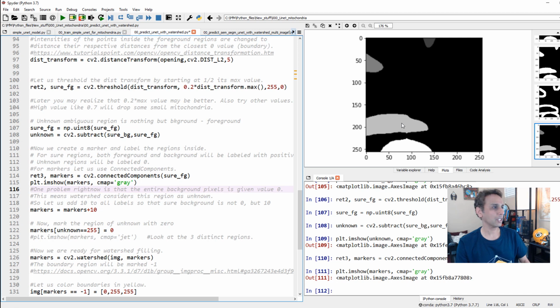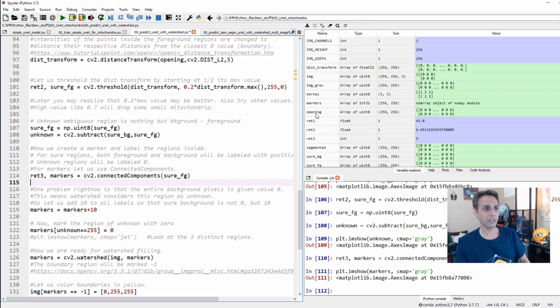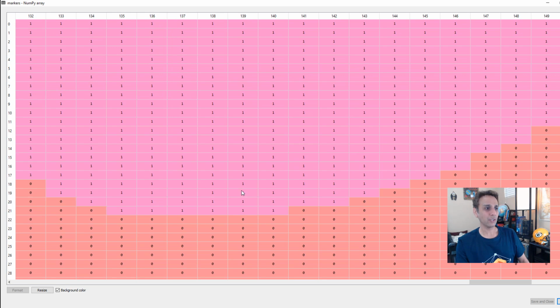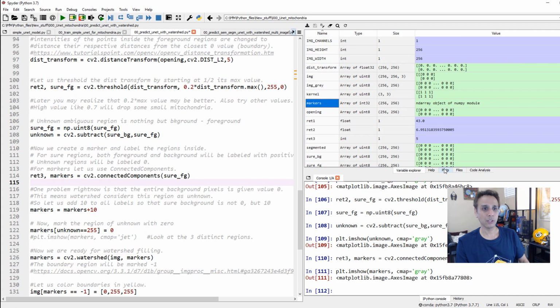So these are all our markers, and again, all it's doing is connected components, right? I mean, it's basically saying, hey, this is not connected, this is not connected to anything. So it actually assigns a value of, I don't know, 1, 2, 3, 4 to each of these objects. So all we are trying to do is connected component analysis here, and separating these markers. Now, if you just look at these markers, if I open this, you see it's got a value of 0 in the background, and here's value of 1, 2, 3, 4, right? So object number 1 probably is all the way up here. So let's do that again. Something that's very important for you to realize. Okay, so you see how this object has a value of 1, background has a value of 0, and the next one value of 2, 3. So let's go back to our plots.